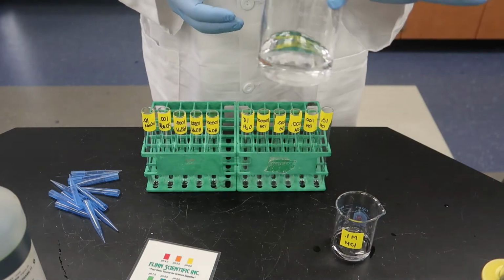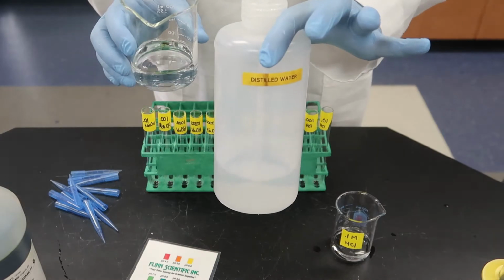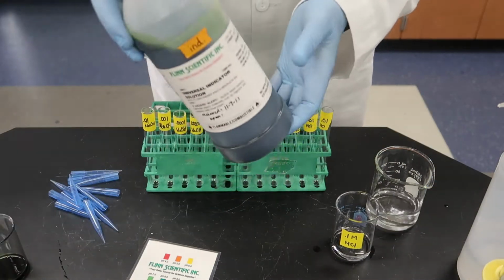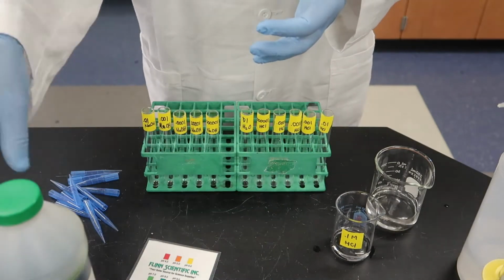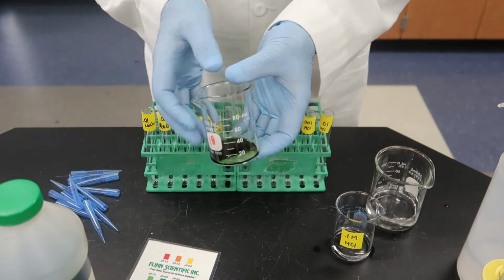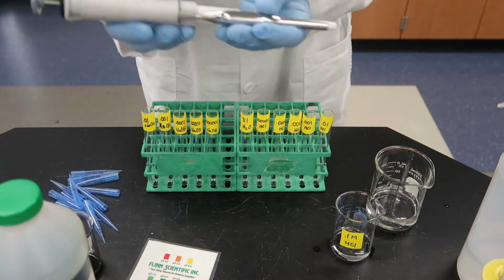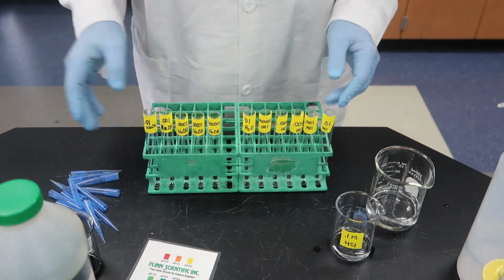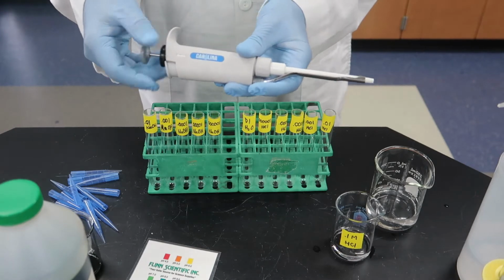But we're starting with a 0.1 molar HCl solution. We have our distilled water, and our goal is to make a number of dilutions of the acid and base. We're just going to do the acid in this demo. Now that was universal indicator. Universal indicator is kind of a green color when it comes out of the bottle, but it changes color with different pH, and we're going to see that demonstrated. We're also using a micropipette as we transfer from tube to tube, and hopefully you've read this and understand how we're going to do that.